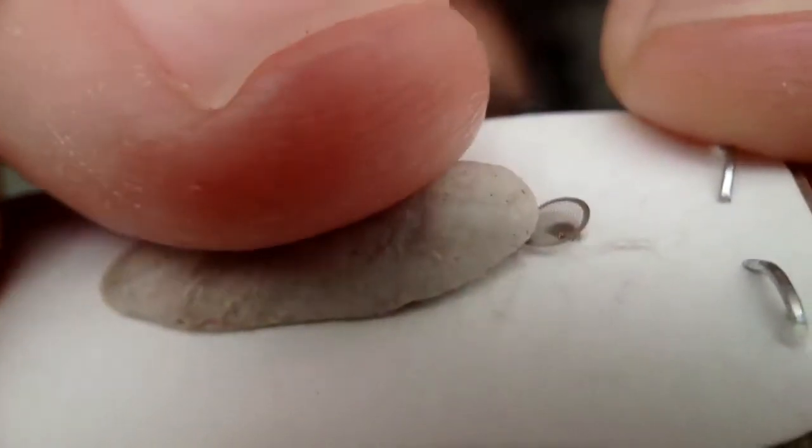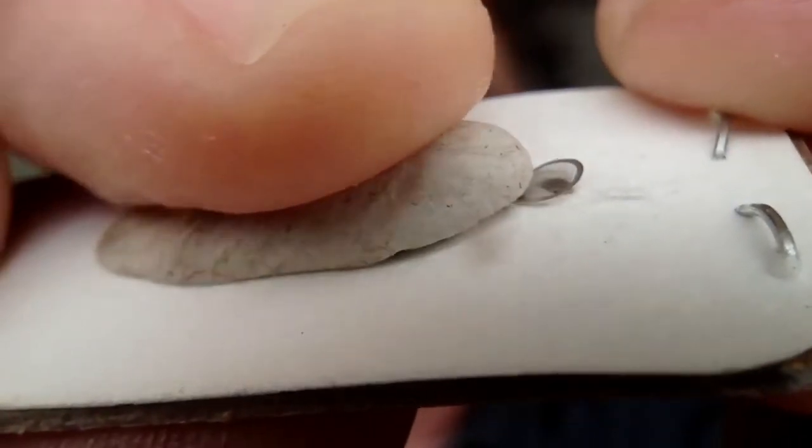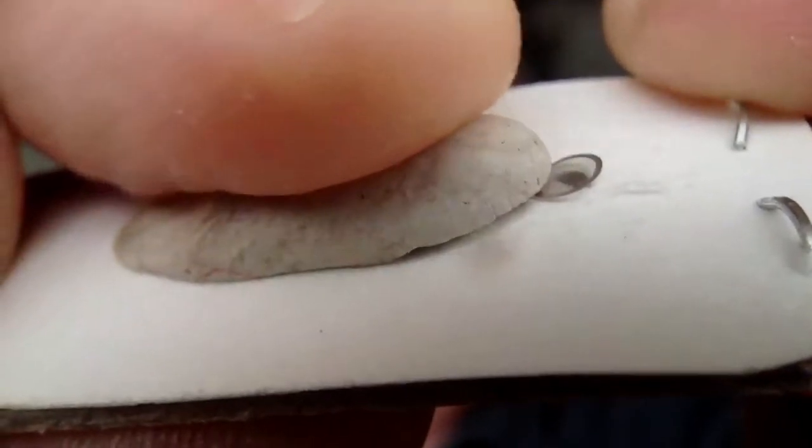And what you do is you put your thumb on it and you pull it forward, pull it down, and it pivots away from the lens. Push it up, it pivots towards the lens. And so you've got your mount and your focus mechanism is just made of a piece of sticky tack. And it works really well. So now when you have your lens, you just hold it up to the light, put a specimen on it, and focus with your finger or your thumb.